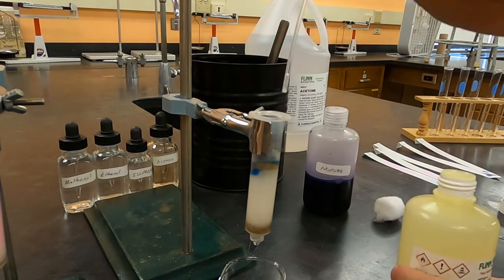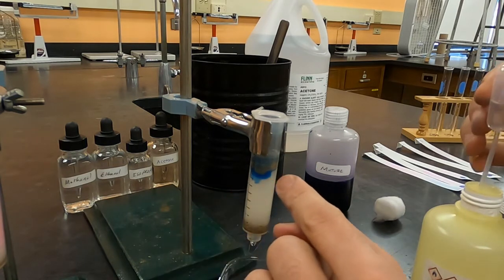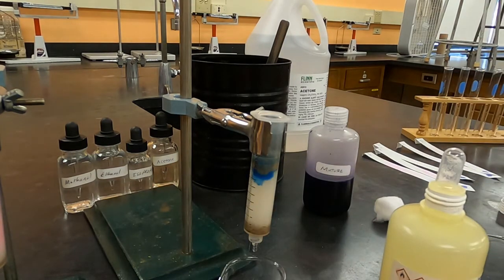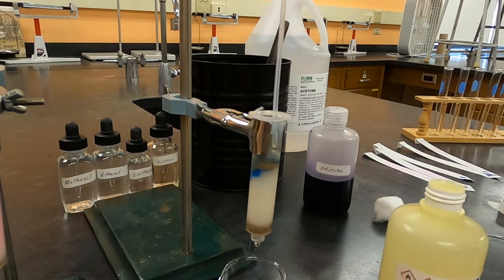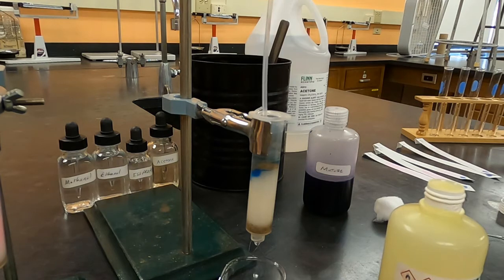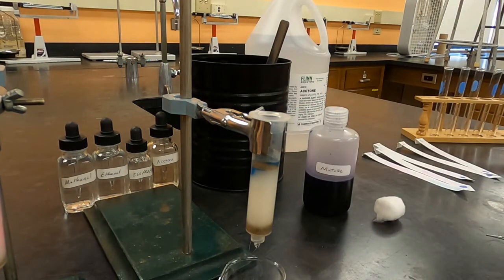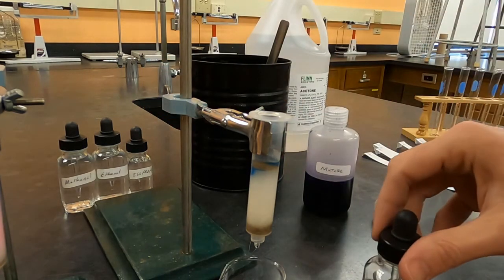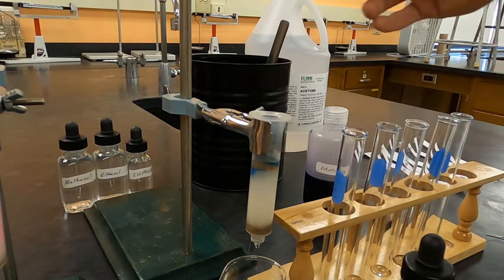I'm going to apply the solvent to get it through the sand. This bubble here is because I didn't evenly apply the sand. We can see that just like with the paper, the ethyl acetate does not seem to be carrying either dye through the sand much or through the packing material. Because there is no movement, I'm going to switch to my next solvent, moving in order to more polar from less. That would be acetone. I'm going to start getting ready to collect since I'm switching solvents to one that is supposed to move these substances.